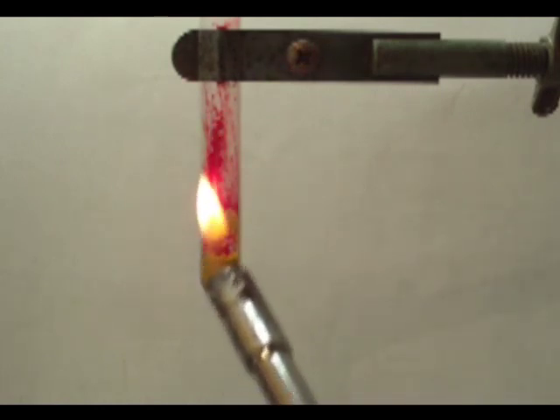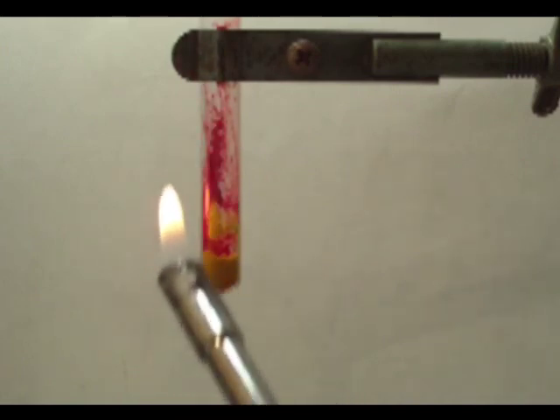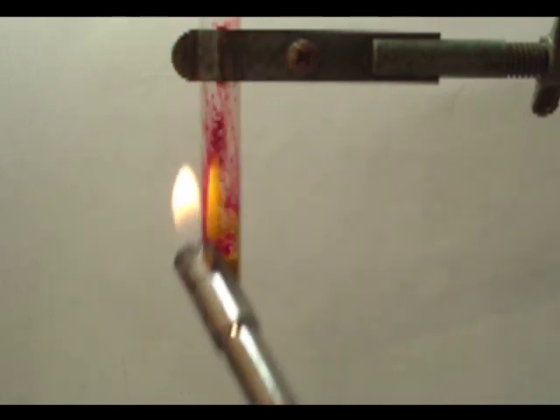After an hour or so, it will convert back to its original color. You can find out more about the thermochromism effect by Googling it. The short version is that the heat changes the crystallic structure, thus changing the wavelengths of light reflecting off of it. And we can play with it a little bit more.